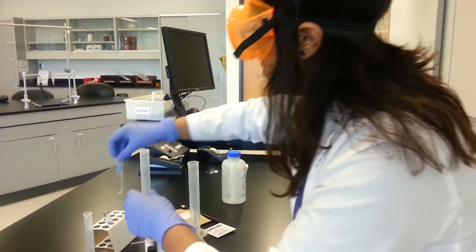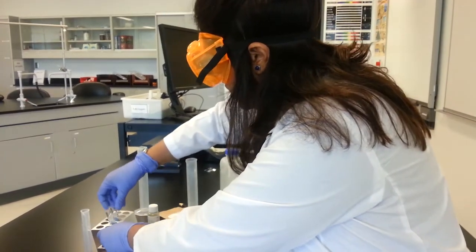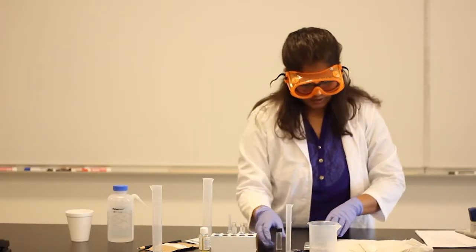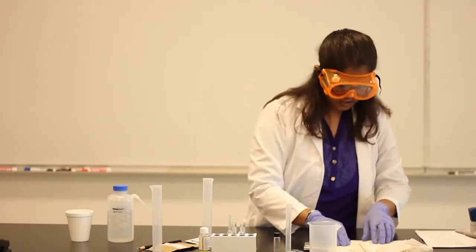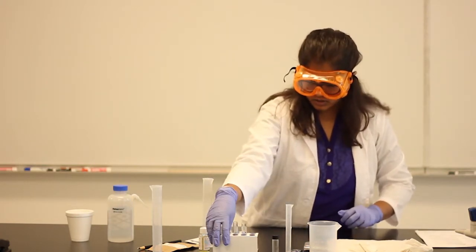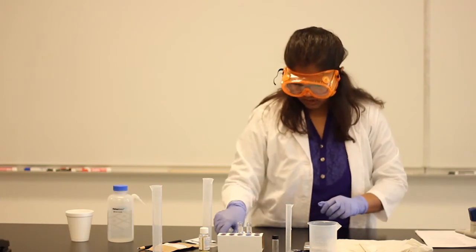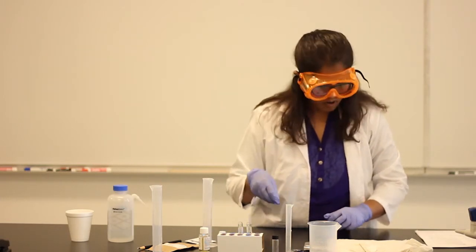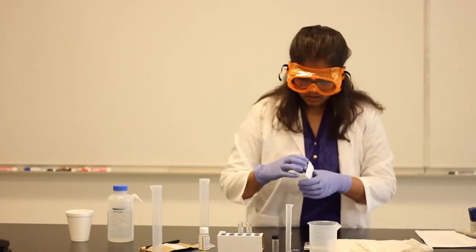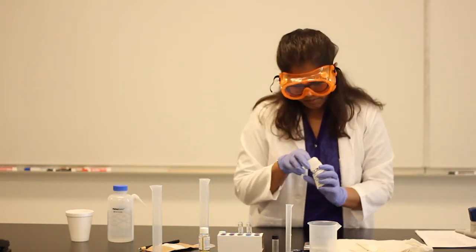Alright, now what else are we going to see? We're definitely not going to use it on our skin to see how well it washes, because we don't know the pH. What if it's too basic? It's going to make your skin too rough. So let's see the pH. How are you going to understand if it is basic or not? Let's use a pH paper.